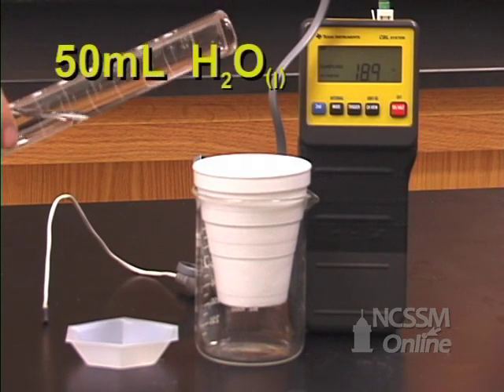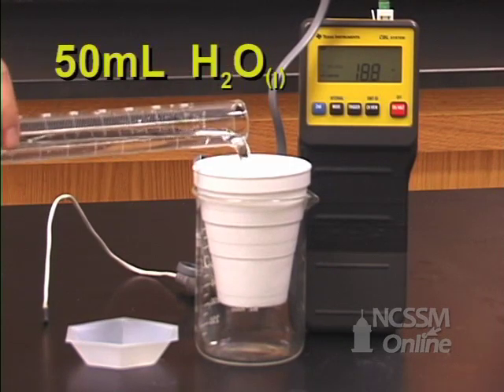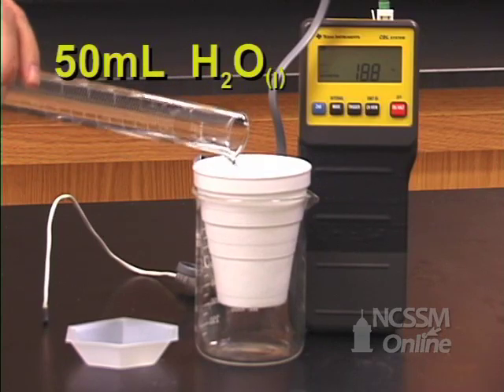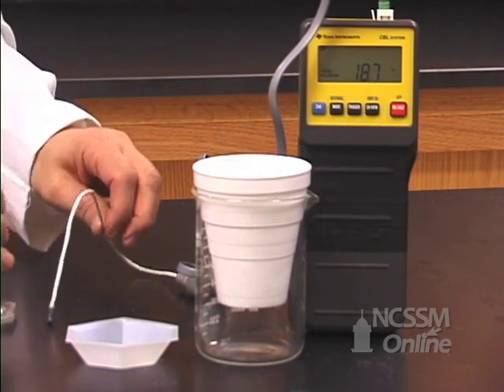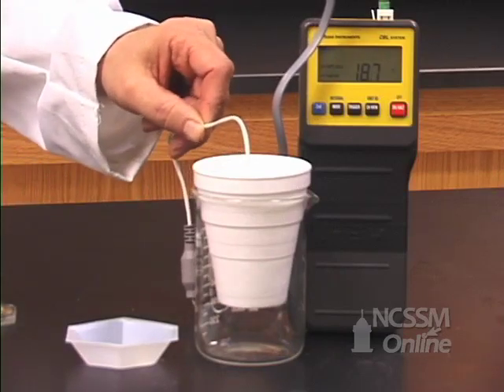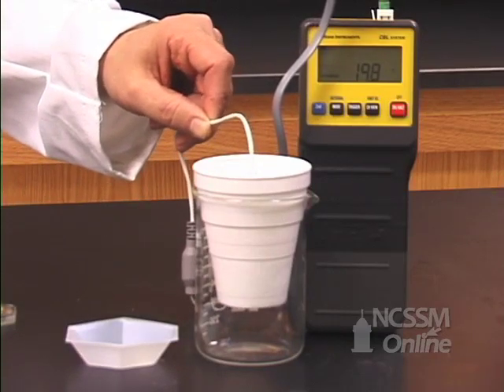Then place 50 milliliters of water into your calorimeter. You will use your temperature probe to measure the initial temperature of the water.